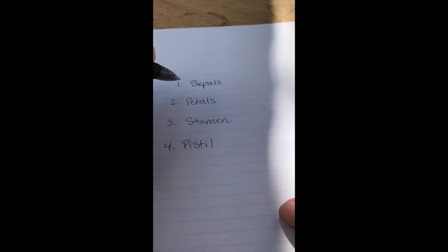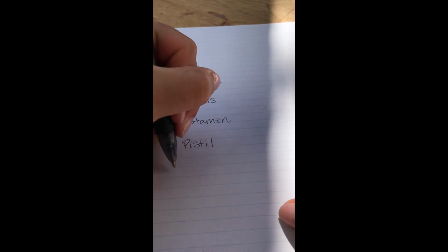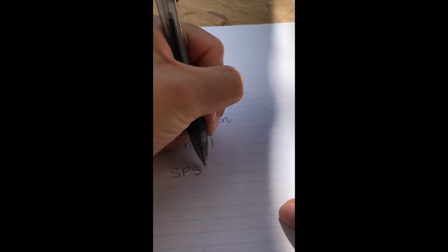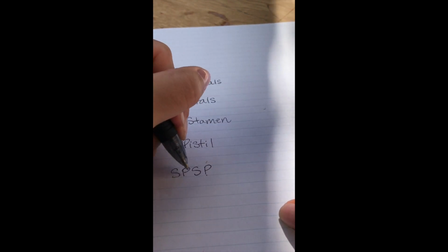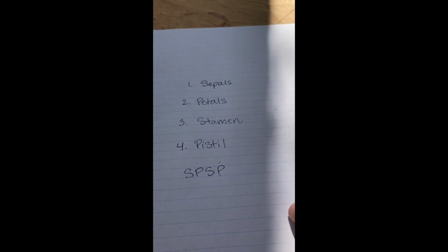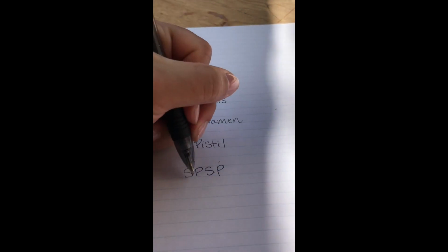So if it helps, you can kind of remember an acronym: sepals, petal, stamen, pistil. It's SPSP, and I just think of it as the sound that you make when you're calling your cat. When you go to get them to come, SPSP. If that helps you, you can use that. If not, feel free to just remember it by looking at it in order or referencing this video.